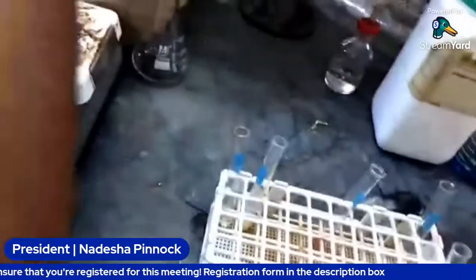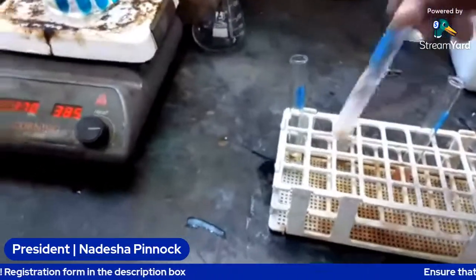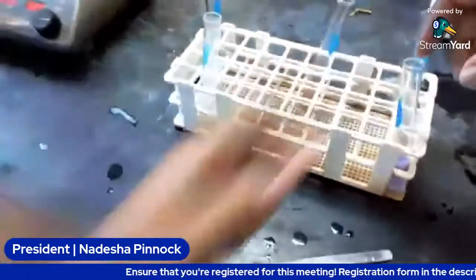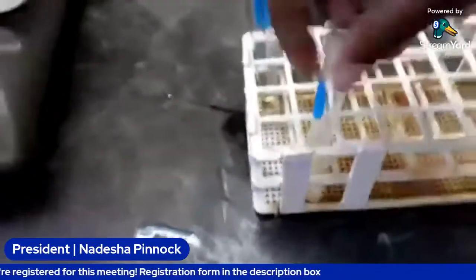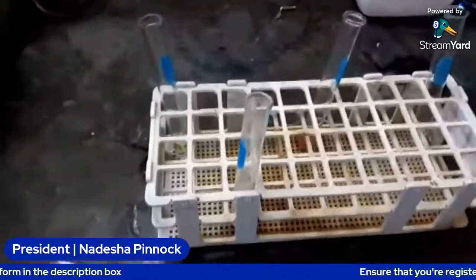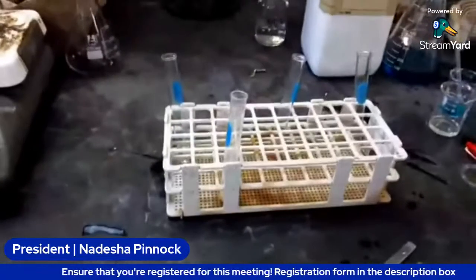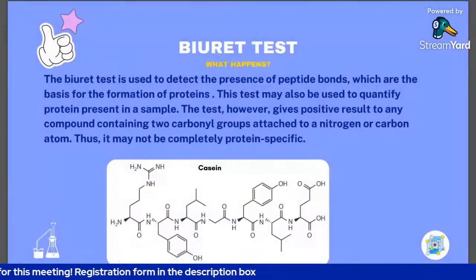So now we're going to move to our Biuret test, which we are doing with our cheese and milk. All right, so this is our cheese, and we're going to prepare a sample of milk for you guys. While we're doing that, we're just going to go through the theory of the Biuret test so you guys know exactly what's happening in the reaction and what we're doing for that test.